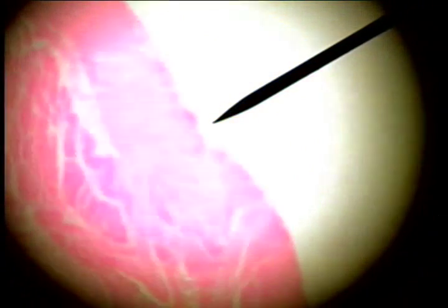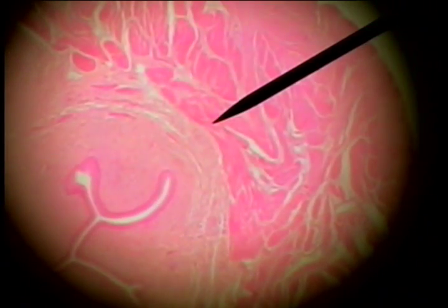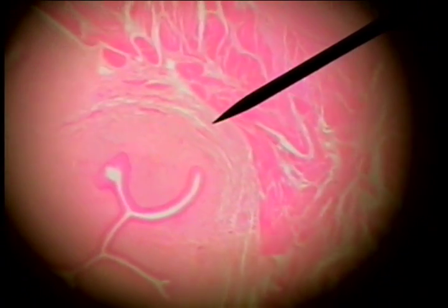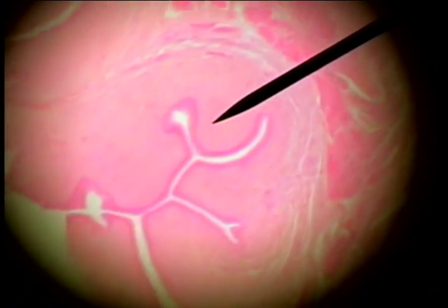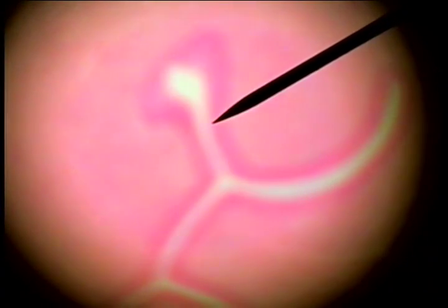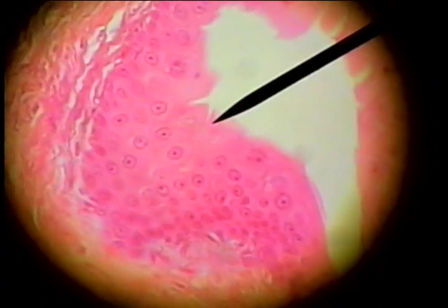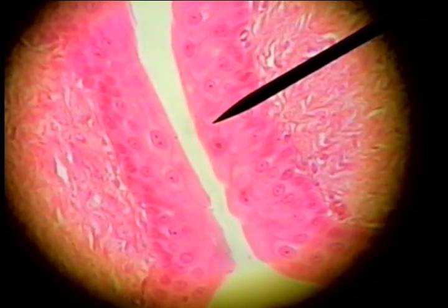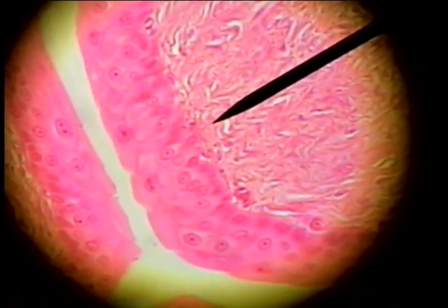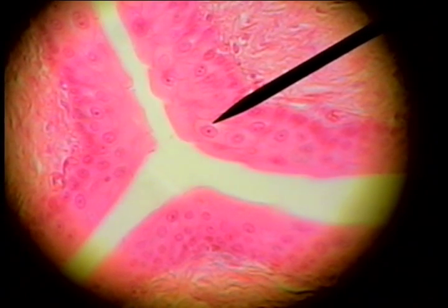If we go back to low power and go through the layers again: the smooth muscle outer thick wall, the mucosa with its lamina propria or connective tissue, and then the transitional epithelium. We can verify this by going to a higher power to see the characteristic balloon cells at the top of the epithelium. And we do see some — there's one there — a very characteristic balloon cell of the transitional epithelium of the urinary bladder.